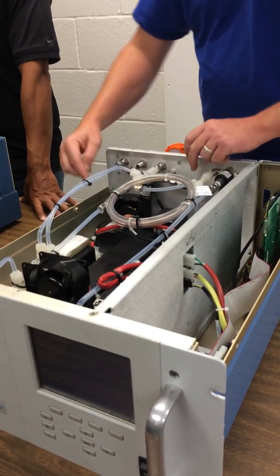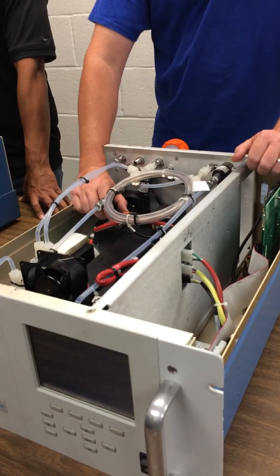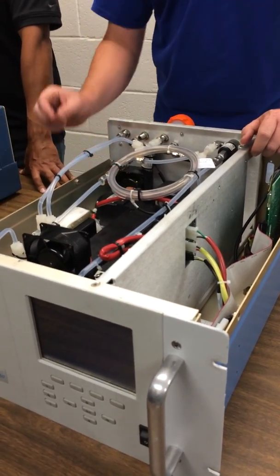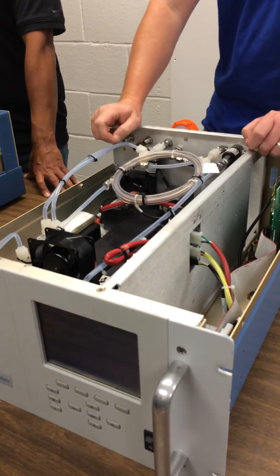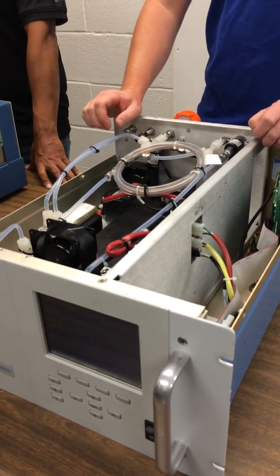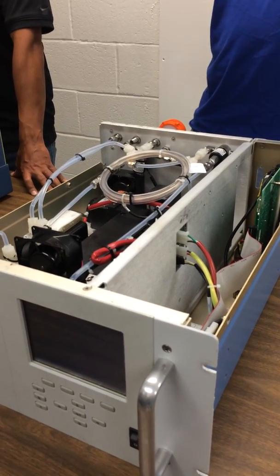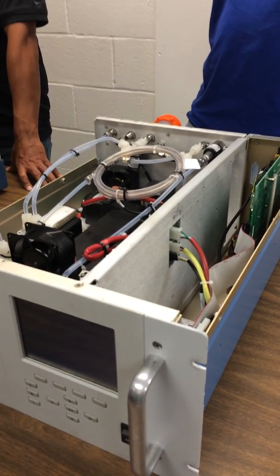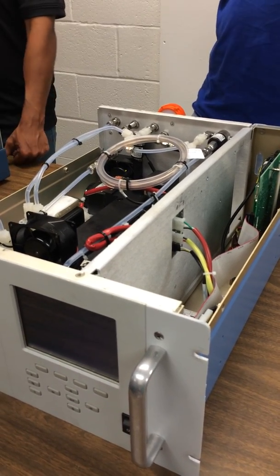This bench has an IR source right here. That's what these two connectors are for. Basically, it's a little heating element. They go out periodically, and it looks like a little resistor, but it's just wires wrapped around a ceramic core, I think. This motor spins a gas correlation wheel. What the gas correlation wheel is, it's a metal disc. It's got two glass cells in it. One cell has nitrogen, the other cell has nitrogen and a known amount of carbon monoxide in it.